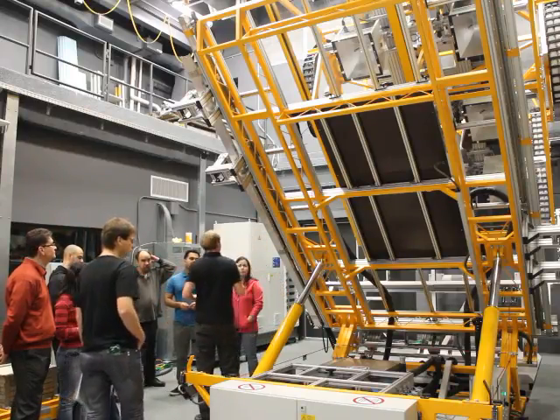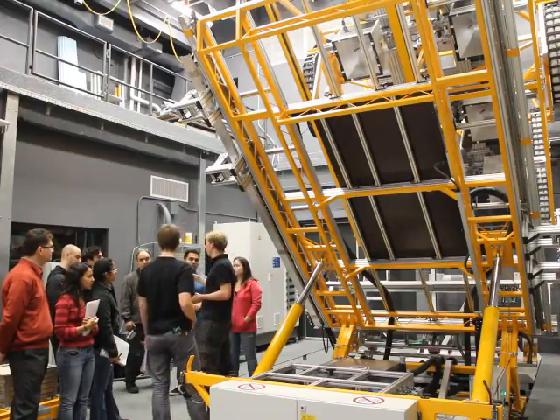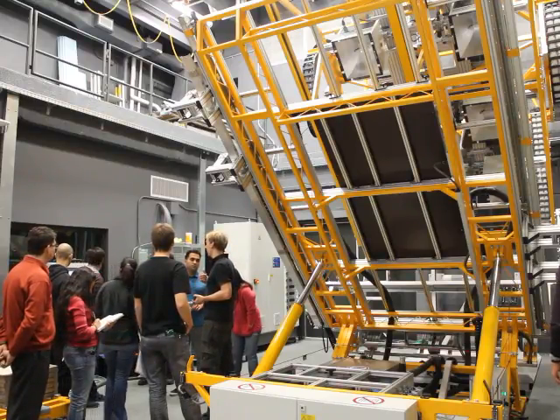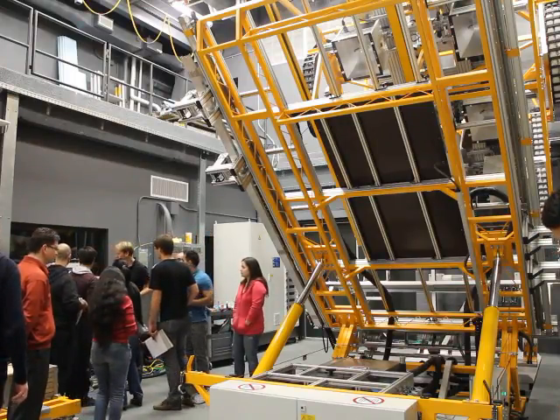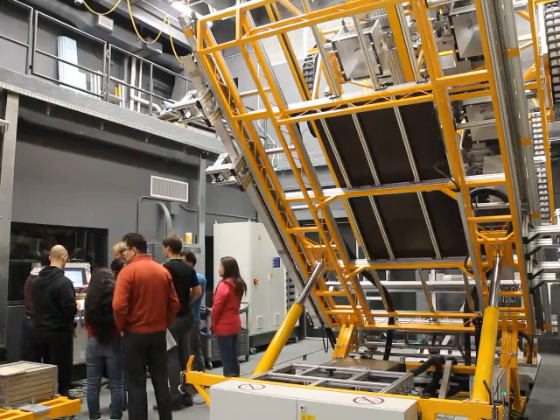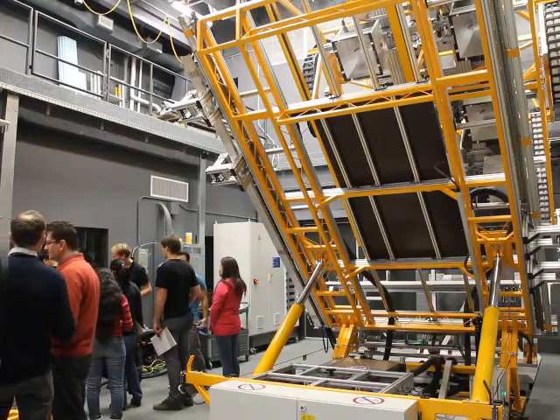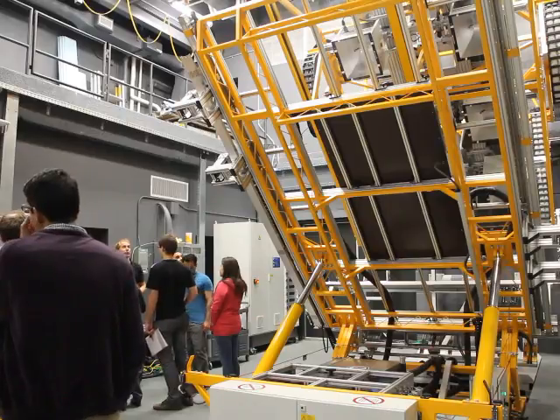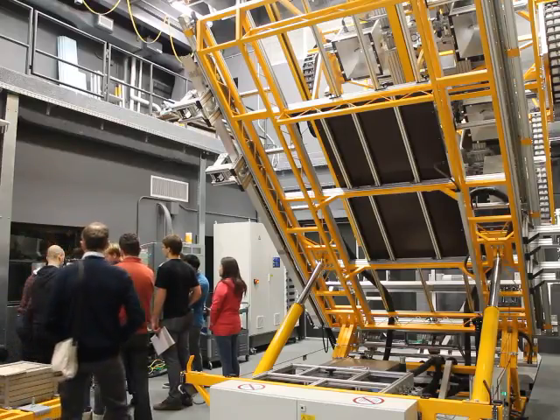Okay. What we already did yesterday is adjusting the scan area. What we should do now already is to load the scan area. I did not do that again today. The same thing is for the geometry of all the parameters. Same is also true for the scanner. For the scanner, you can reload. We will check that.